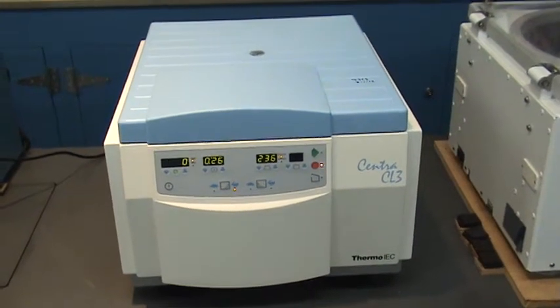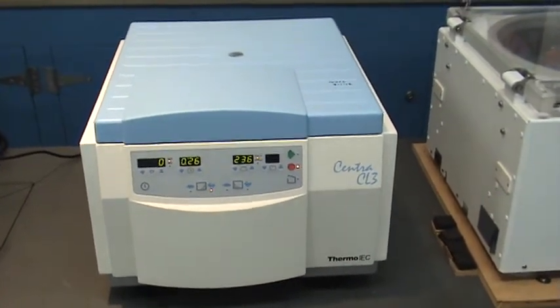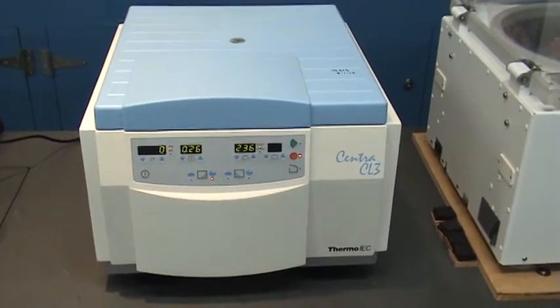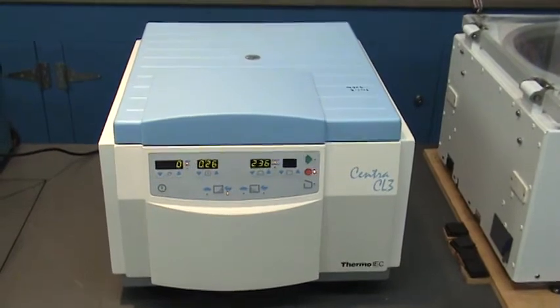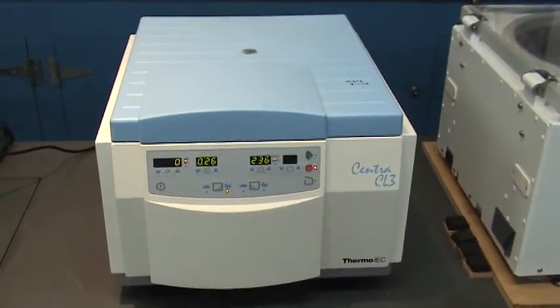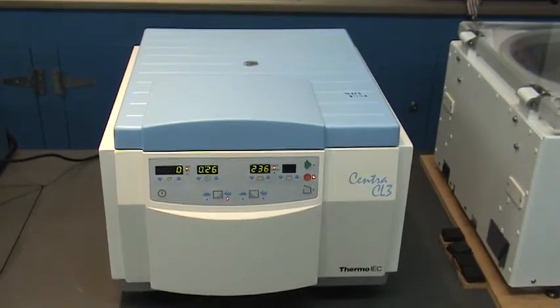This video is about the balancing feature of a standard, commercially available centrifuge, versus a new device called Rotor-Mate that improves the balancing ability of the centrifuge.